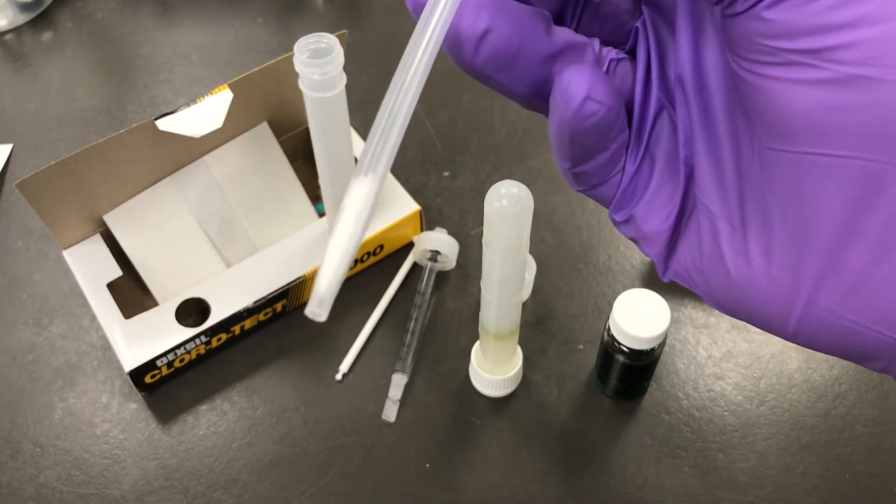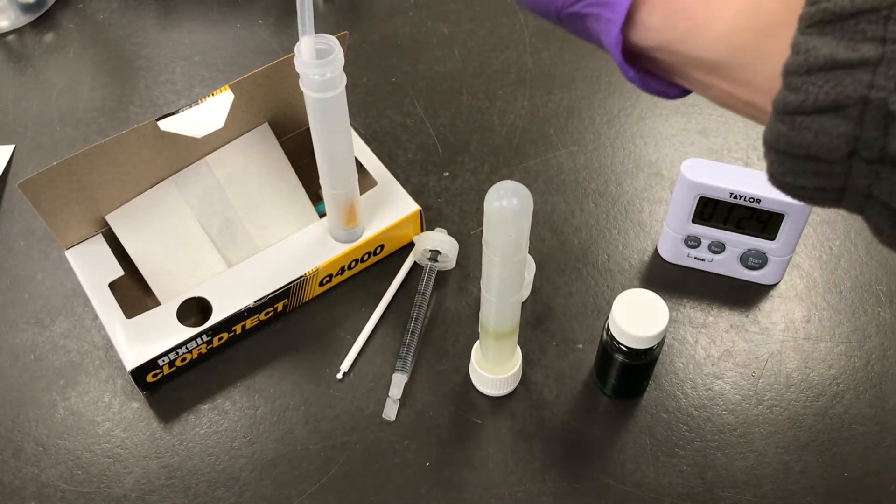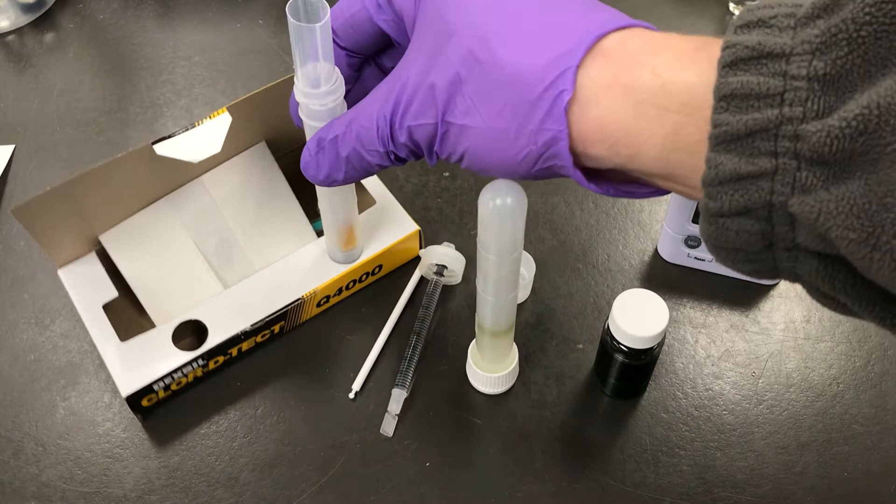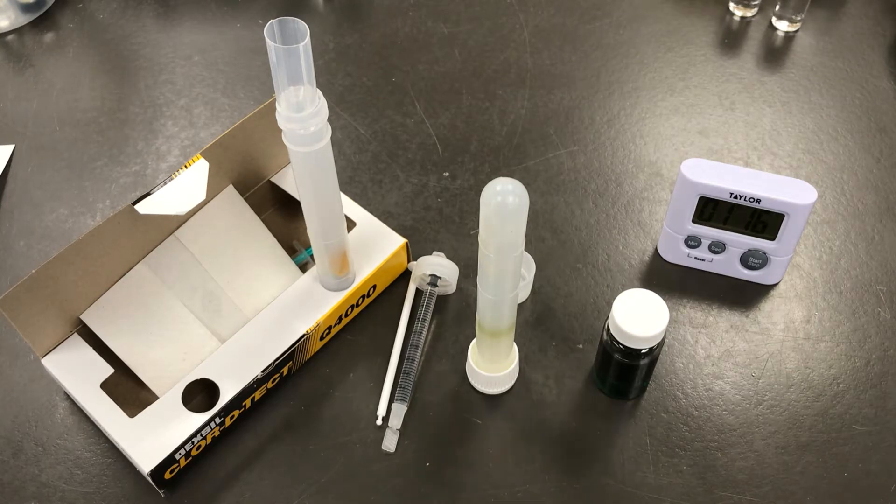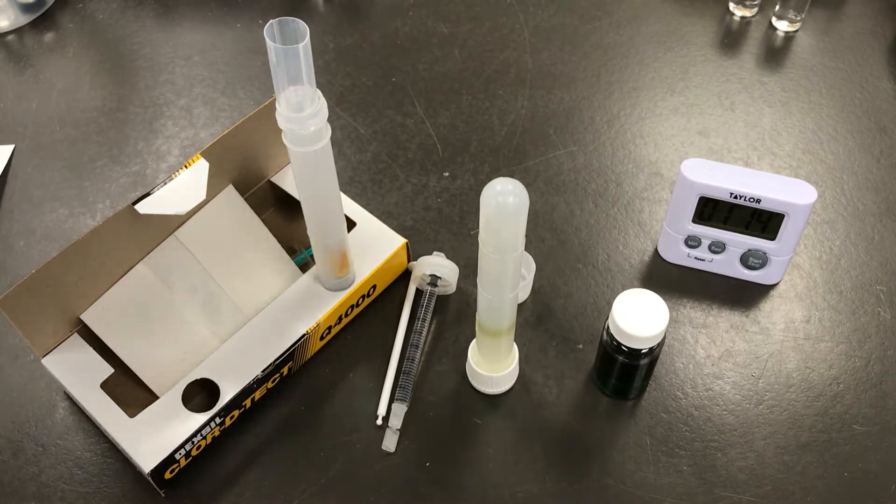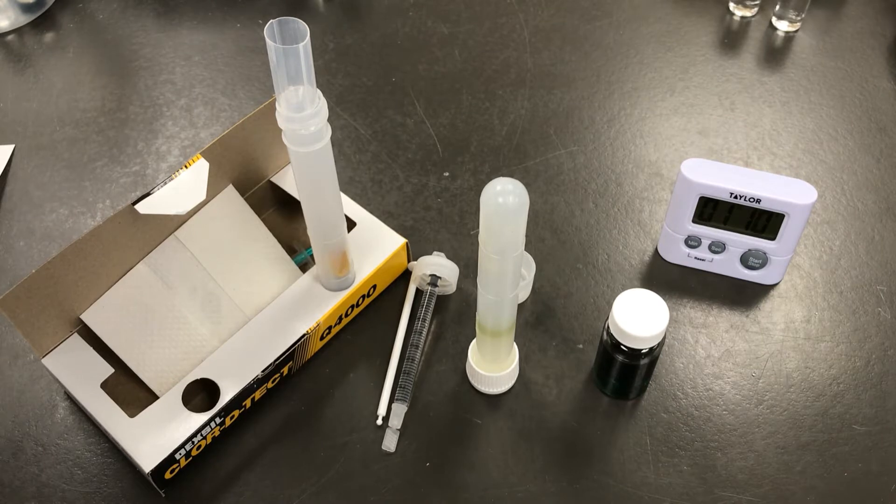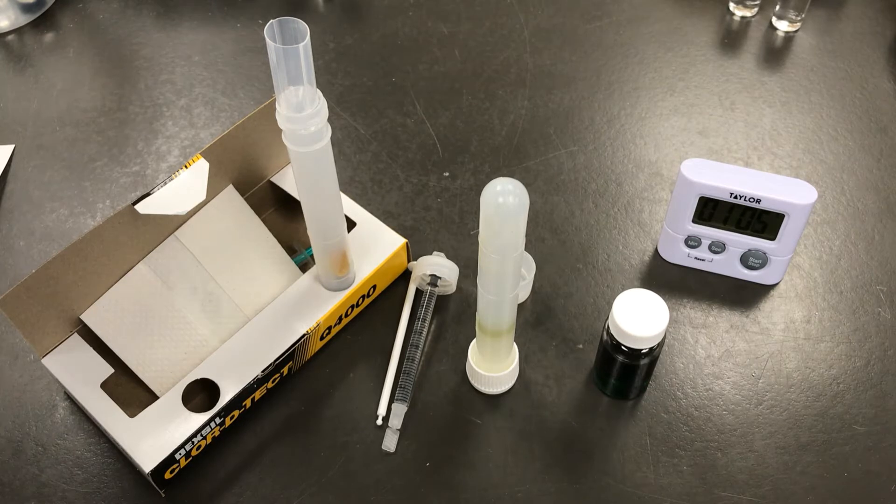You can prepare for the next step by taking the filter funnel and placing it into the top of test tube 2. It's important to wait for the full 2 minutes. If the phases are not allowed to separate for the full 2 minutes, it could impact the final result of the test.